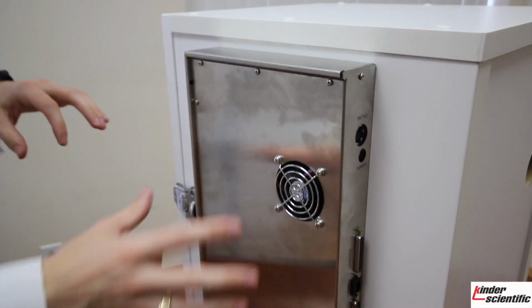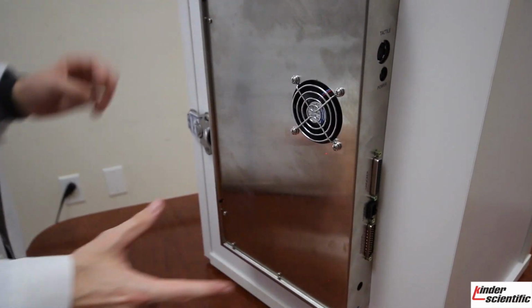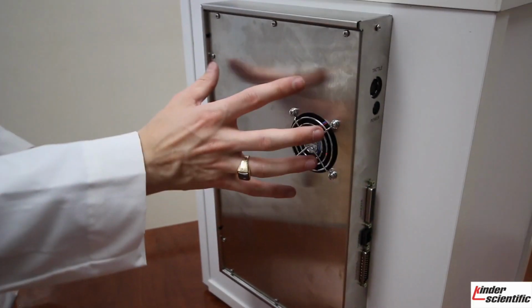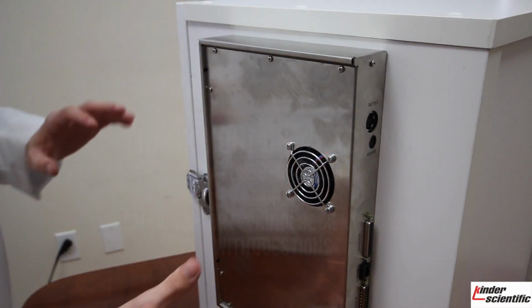Congratulations, you have now replaced the board located inside the StartleMonitor chassis. You've learned how to remove the vernier dials, remove the screws and jack screws, and how to take the board off, what to disconnect, and how to reconnect it and put everything back on. And that is the tutorial for that.